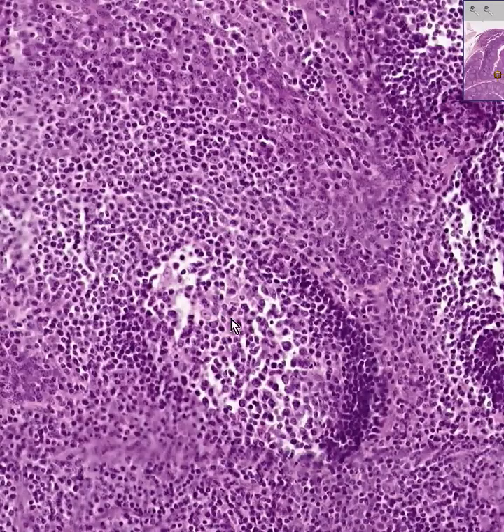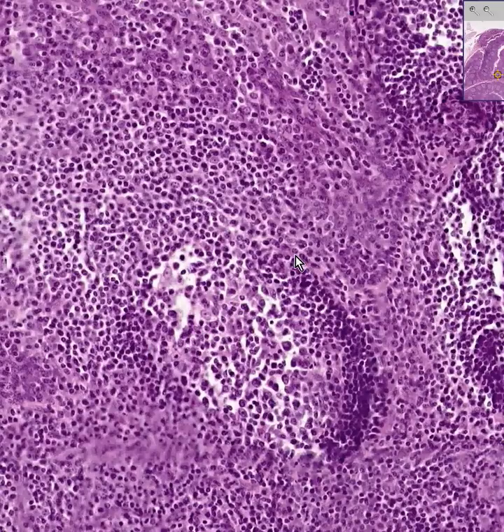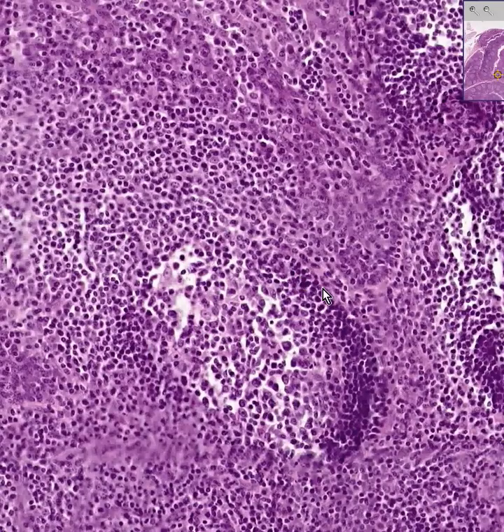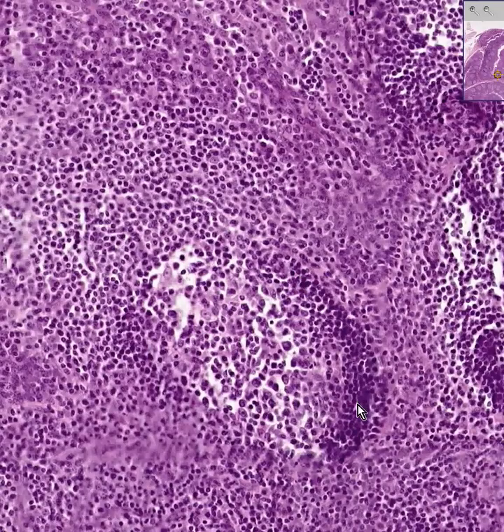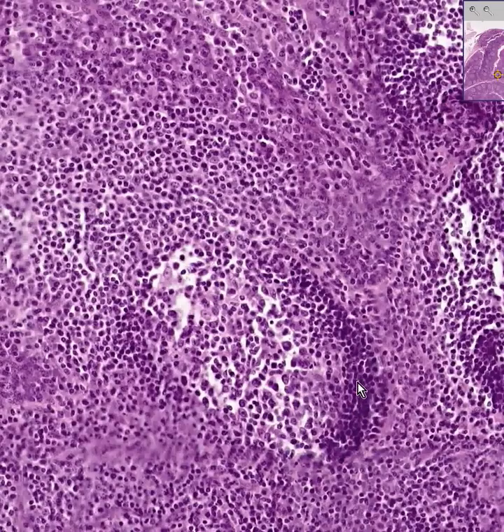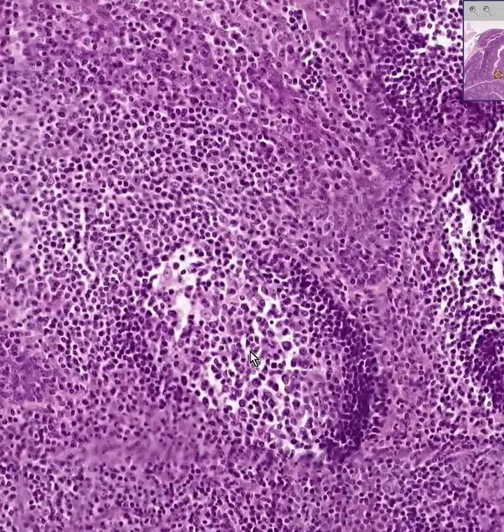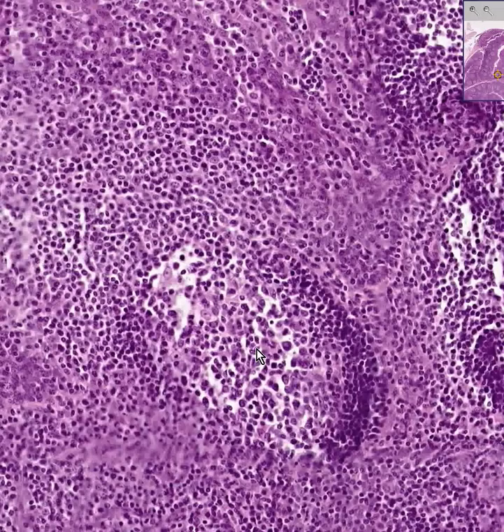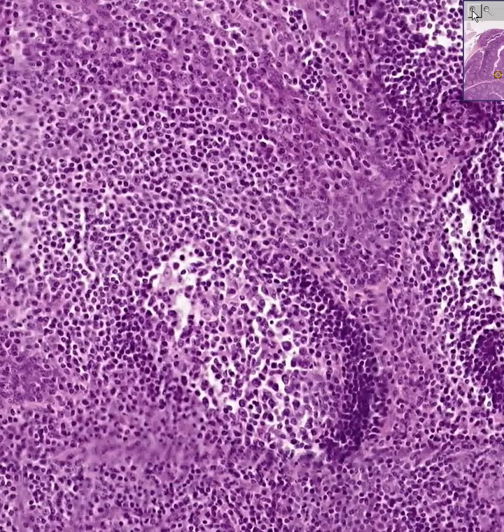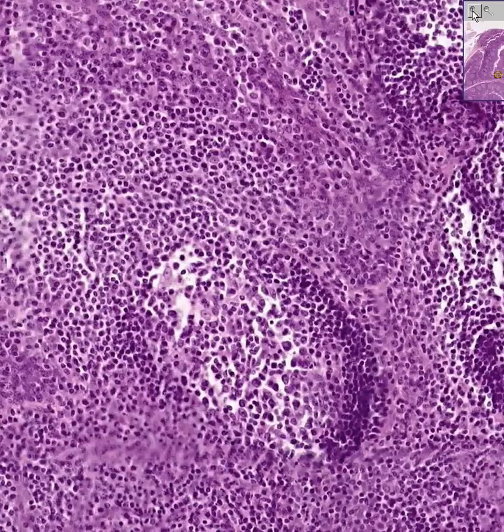The germinal centers appear lighter because there is more cytoplasm per cell. At the periphery are the denser, smaller, bluer lymphocytes, mostly because the amount of cytoplasm is less than in the center of the follicle. This is characteristic of practically all lymphoid tissue and all tonsillar tissue.